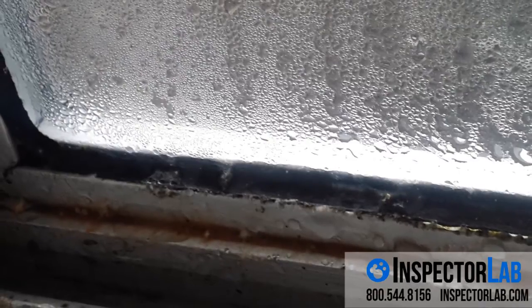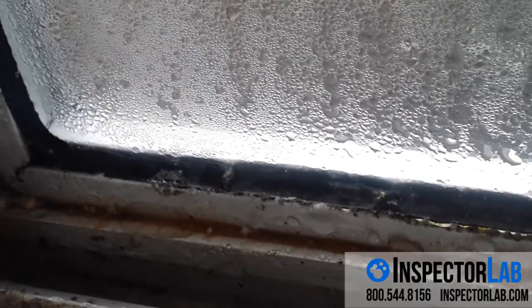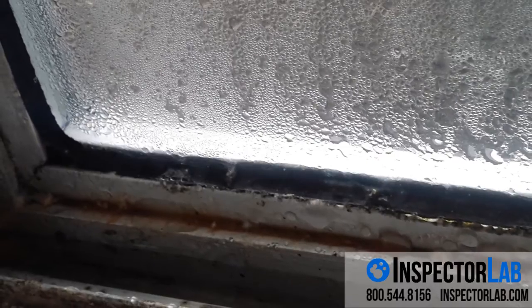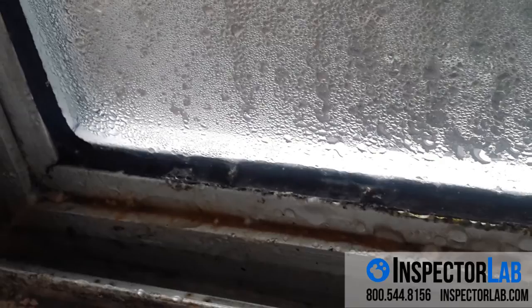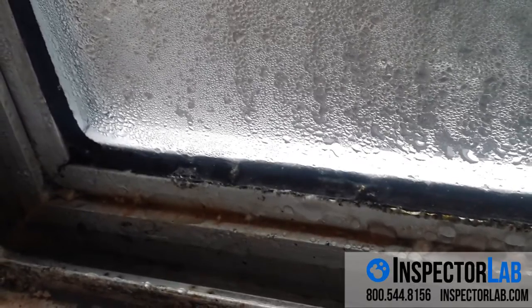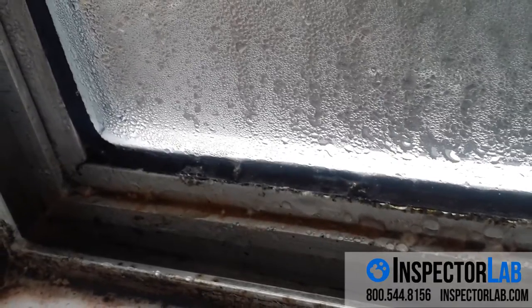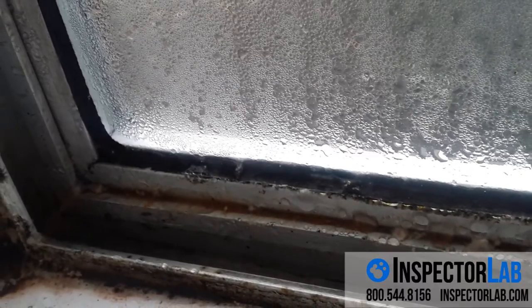Bulk samples can be used for answering questions about visual growth on any kind of object or material. A bulk sample is a physical sample of any object or material to investigate whether a substance is mold. Sometimes a bulk sample is collected because a client needs to know if a certain material has mold on it — for example, if a shipment of fabric or linens is moldy. Other times a bulk sample is collected to discover if a substance on a surface is mold and if that mold growth is the origin of mold spores in the air, as determined using air sampling cassettes.